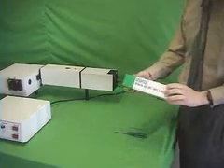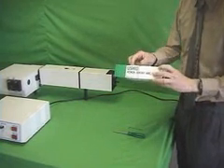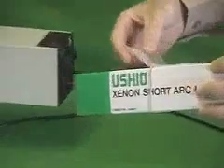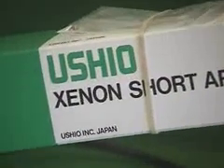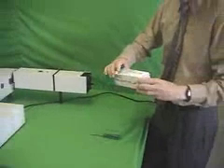The arc lamp is contained in this shipping box and on the outside are set screws, a bag of set screws to plug up the nitrogen flow through holes here, and also three small set screws for the lamp. We'll do that later.